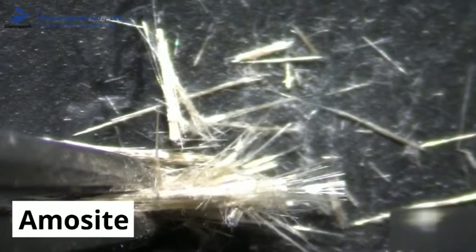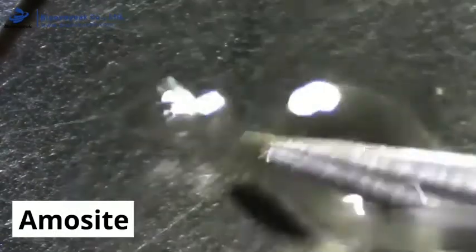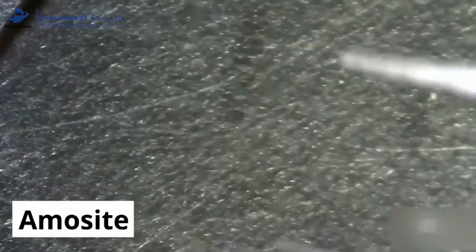These fibres are mounted onto a microscope slide in an oil which shares similar optical properties to that of the suspected asbestos type. This is then assessed under the polarised light microscope by rotating the fibre and changing the settings. This first test searches for pleochroism and relief, and would present as a change in colour or the fibre standing out significantly against the background.